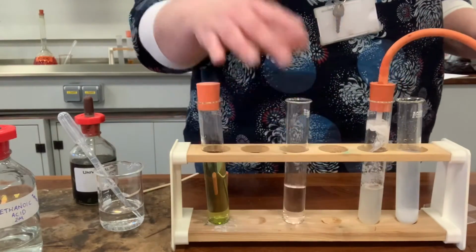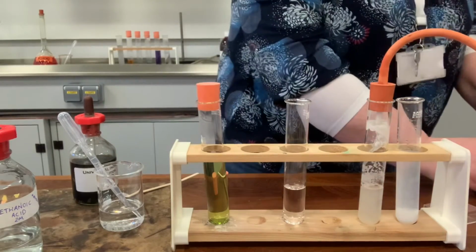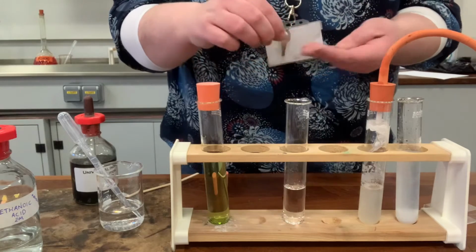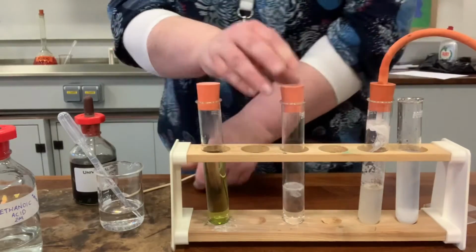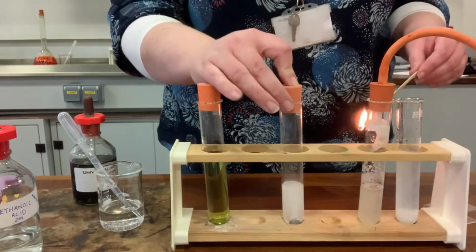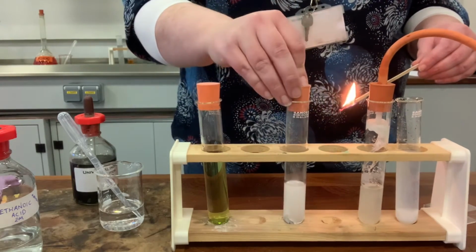So the third test is when we react a metal with an acid, and this is in your booklet as well. A metal plus an acid gives you salt plus hydrogen. So I'm just going to add some little strips of magnesium ribbon in. We'll react the magnesium with the acid and we should get hydrogen gas. You remember from Unit 1 that the test for hydrogen gas is that it burns with a squeaky pop. So I'm just going to leave it for a few seconds to let some hydrogen build up and confirm with the splint that it is hydrogen, because it will burn with a squeaky pop.